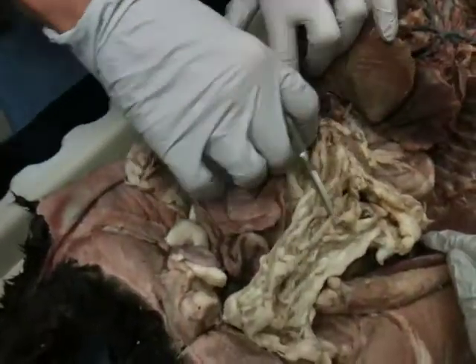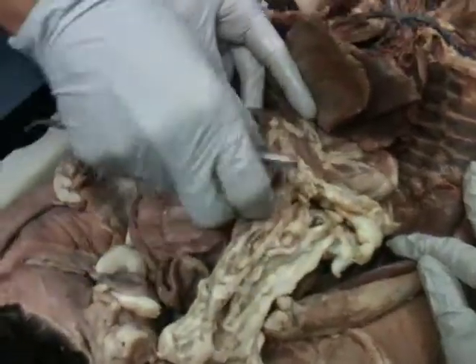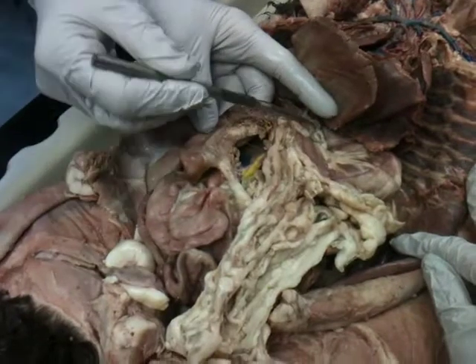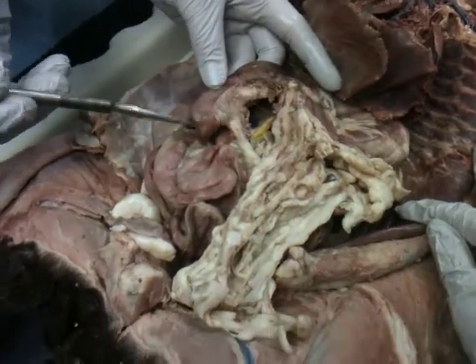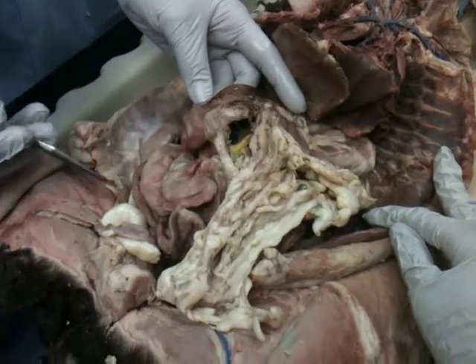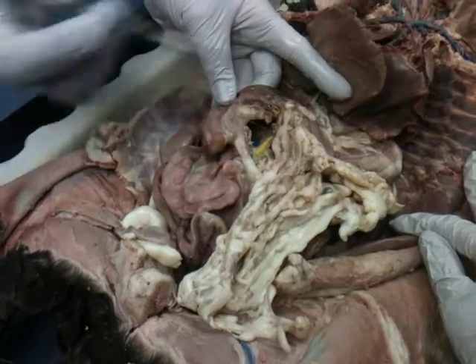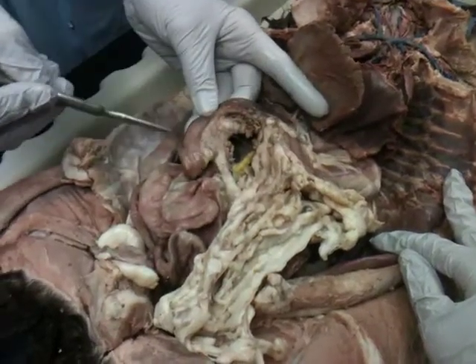The small intestines has 3 different parts. You do not need to know the 3 parts. You do need to know the first one, which is the duodenum. It goes duodenum, jejunum, ileum. Those other 2 parts you don't need to differentiate. And then it goes to the colon, the large intestine. So here the stomach is going to the duodenum.